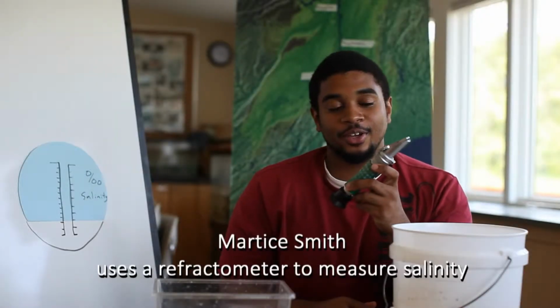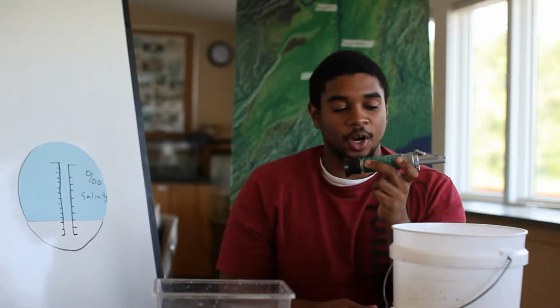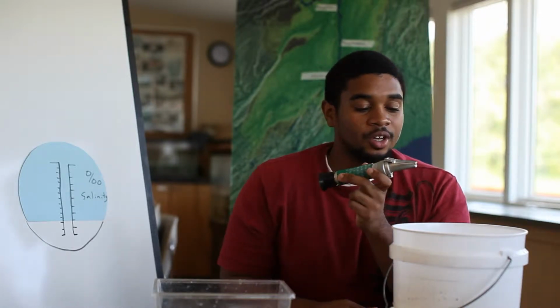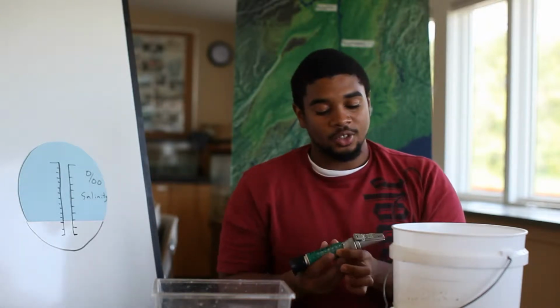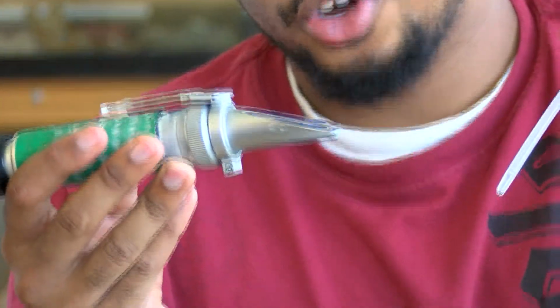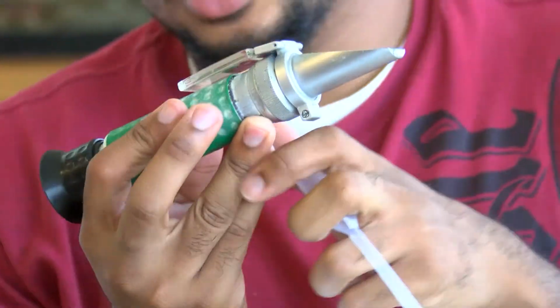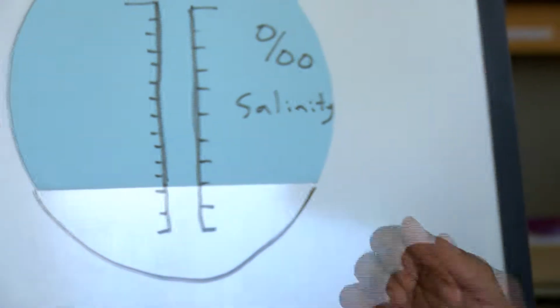So this device I have here is called a refractometer. It's used to measure salinity for different waters. We're going to be using it today to measure brackish water. How this works is light would refract through a thin layer of the water, and it gives us a value on these scales. We'll be focusing on the salinity one.